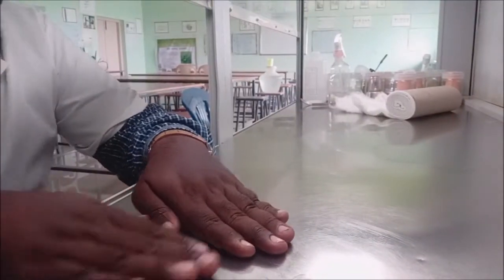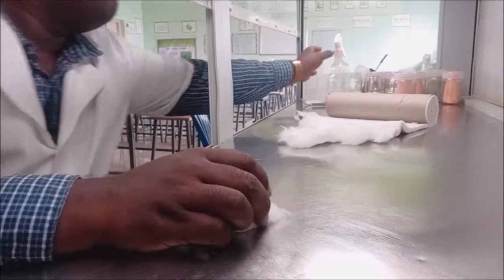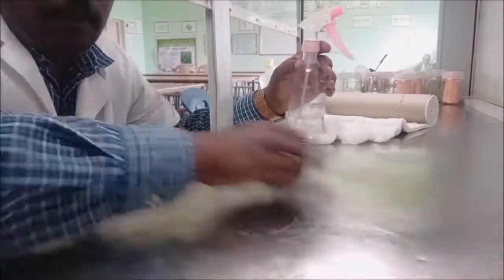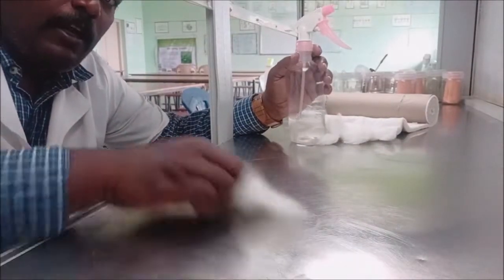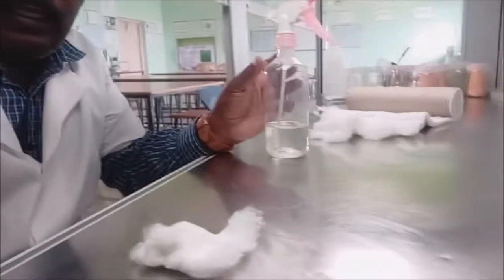Another important step is to wipe the surface with 70% ethanol. You have to wipe and clean the surface thoroughly. Cleaning the surface with 70% ethanol is necessary before working in the laminar air flow chamber. These are the precautions to follow before using the laminar air flow chamber. Thank you.